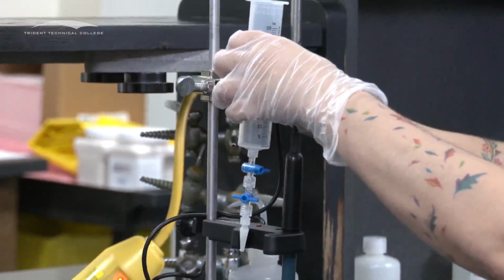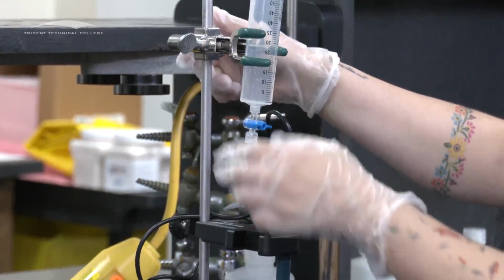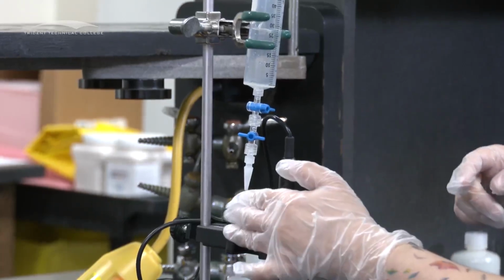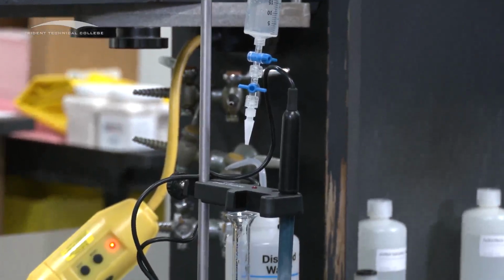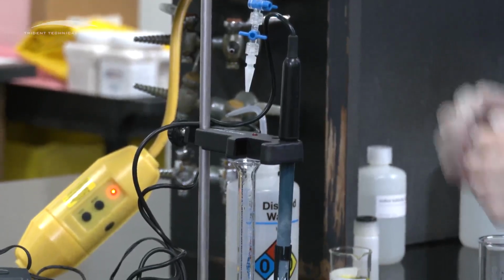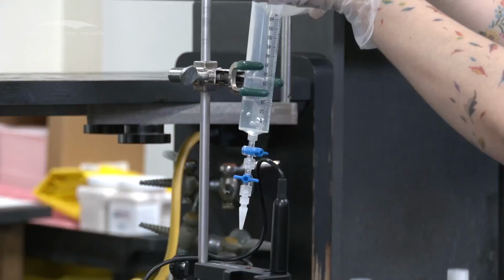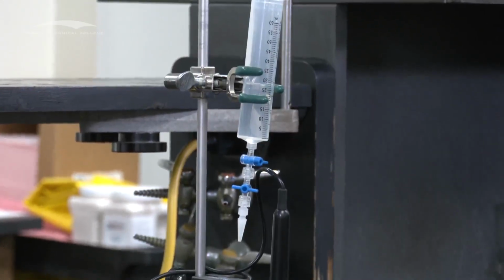And this is not the most scientific measurement, but you want about 2 to 3 fingers height from, so your drops have to go through here, and you want to go about 2 to 3 fingers-ish. I know, not the most chemistry measurement, but it works really well. And then you want your graduated cylinder right there. So I'm going to close both stopcocks, and I'm going to fill this with water. You only need about 20 mil, 15 mil. You don't have to measure it. Just make sure that it's about halfway filled.